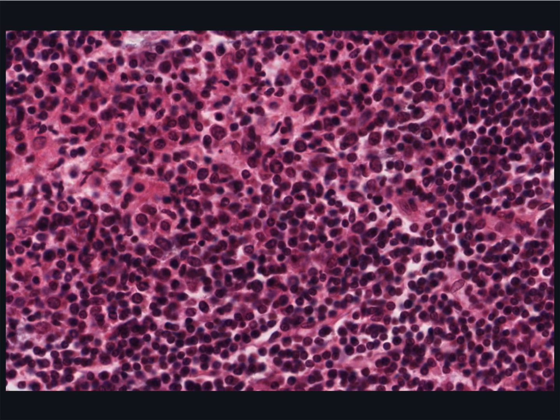The large pale nuclei, which seem to have no cytoplasm at all around them, are follicular dendritic cells. These cells actually have a lot of cytoplasm, but it's stretched out into long arms that extend out of the plane of section. Their function is to hold antigen molecules on their surface and present them to lymphocytes.